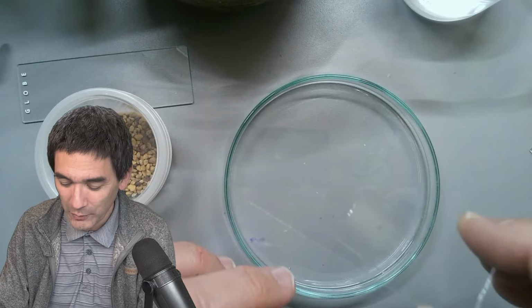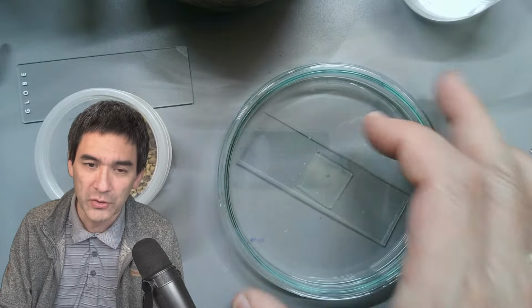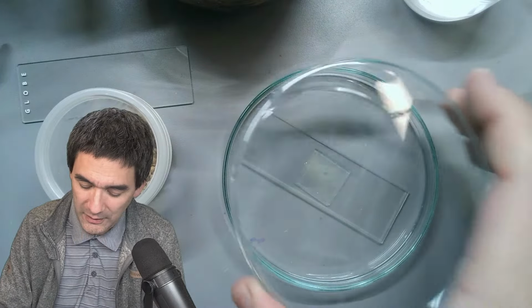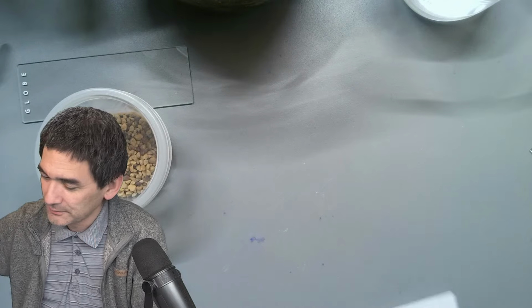Yeah, and it's part of the hobby, so to say, that not everything works. And for your info, when I have a slide here, I usually put a lid on top to slow down the evaporation. But essentially we can throw this slide away. Okay, so that's not needed anymore. So that is number one.